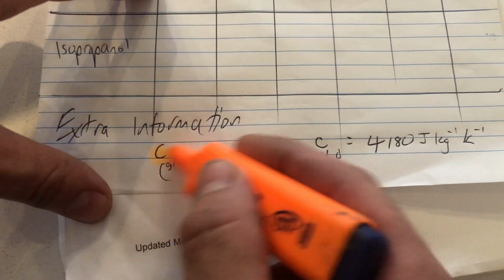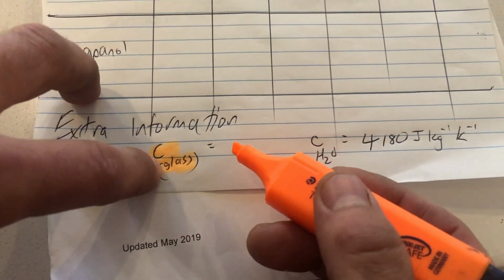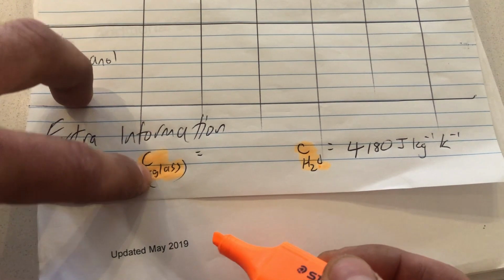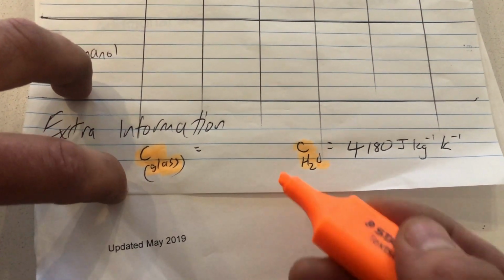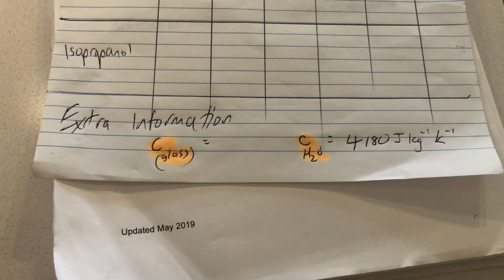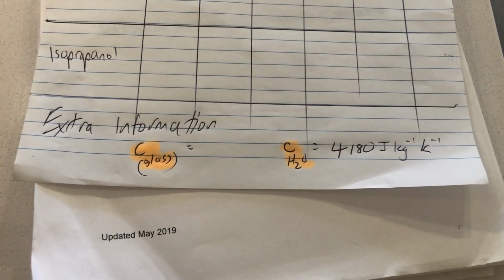We're going to need to do some research and find some data on borosilicate lab glass and find out its capacity to store energy, which would be a much smaller value than water. Hence why it's not very good for this sort of experiment. Some people would use glass, but most people would actually try and use something that's really good at conducting the heat from the flame into the water, such as a copper can. And they'd also account for the heat capacity of that can.